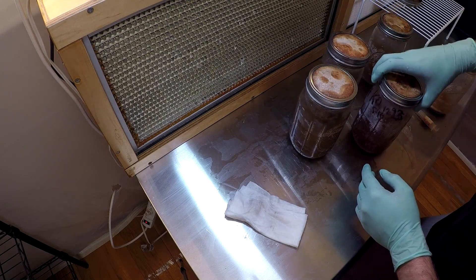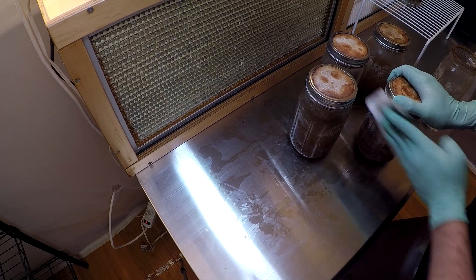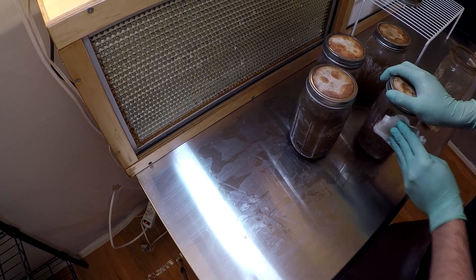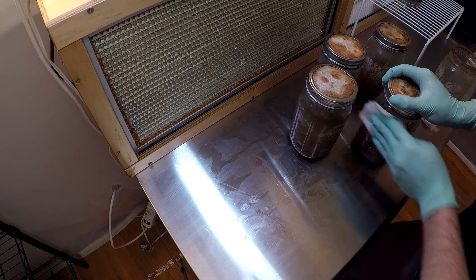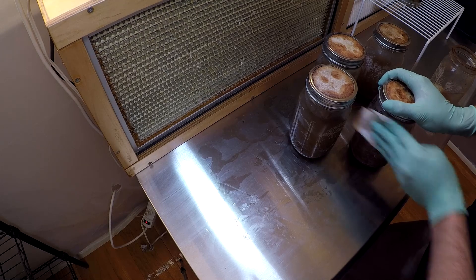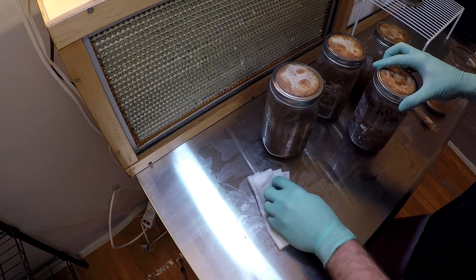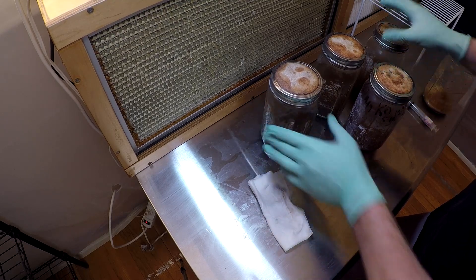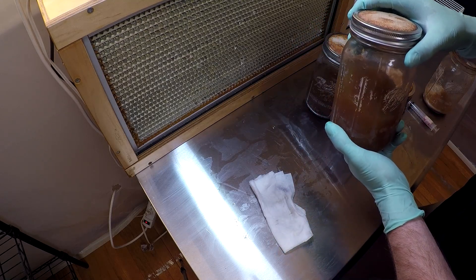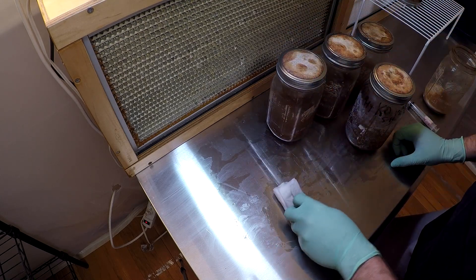Give it a little swirling. If you see any old writing on your jar, go ahead and wipe it off. Usually to get old permanent marker off you have to use denatured alcohol, because isopropyl just isn't effective enough — you can see it's not really doing anything. When I get these towards the fridge, I'll clean them off with denatured and write the label on them. Make sure to label these with the proper culture and the proper date. These are all King Oysters. And in about two weeks, you'll see a good amount of growth coming off the bottom, and that's when we'll run the mix again to redistribute it.